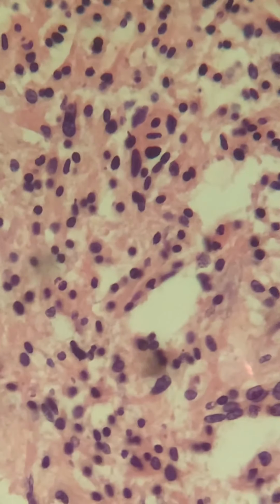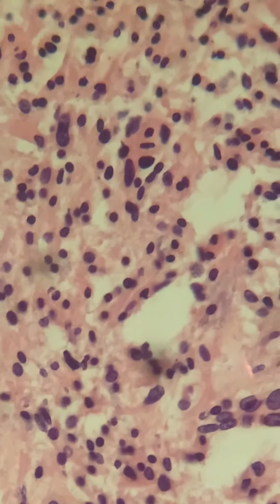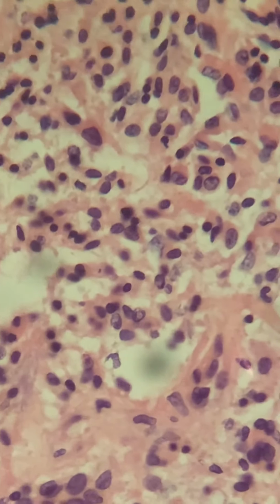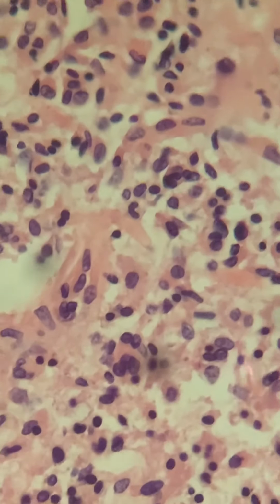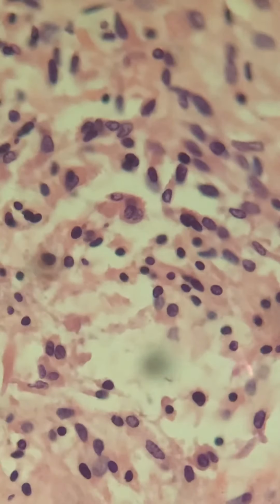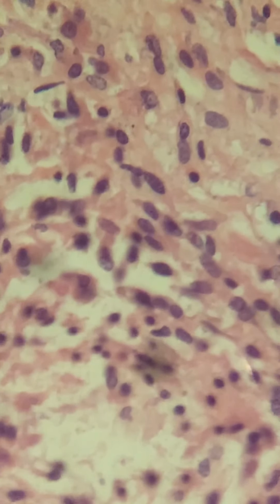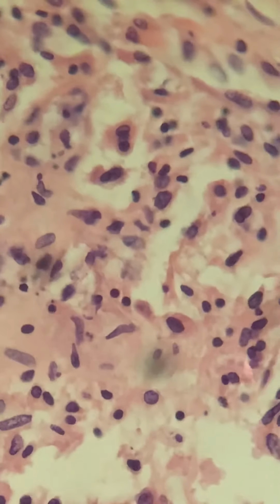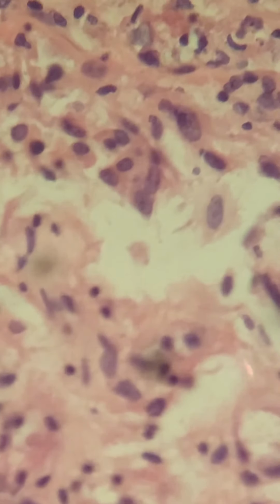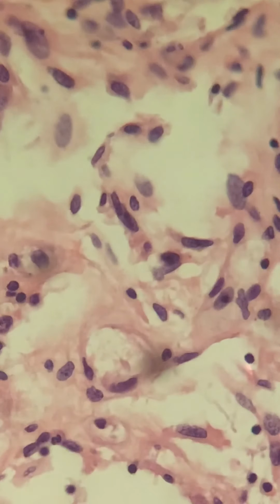But again, we will see here a little more pleomorphism. See the spindly cells? That's very hyperchromatic and spindly, a little more pleomorphism. Some of this could have been radiation changes, but some of this also could have been the de novo aggressiveness of the tumor. We would have required looking at the original pathology from the institution that performed the original surgery, but we were never afforded that opportunity. Be that as it may, this was signed out as an aggressive, in parentheses, malignant meningioma with subsequent brain herniation and brain death.